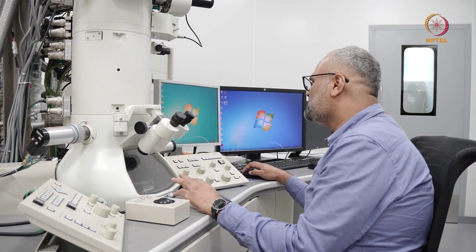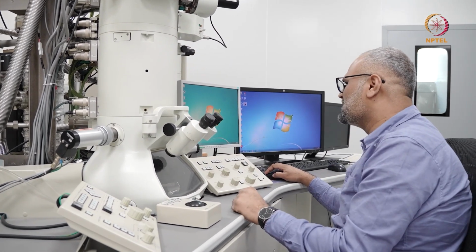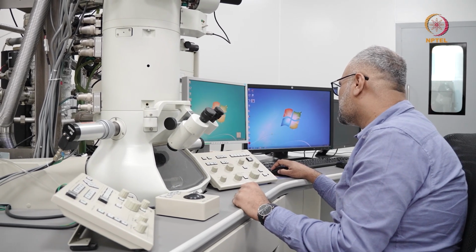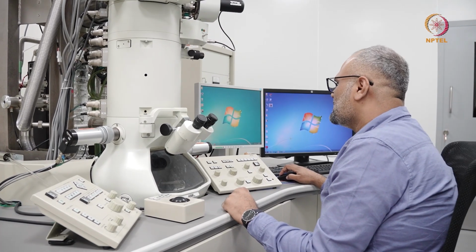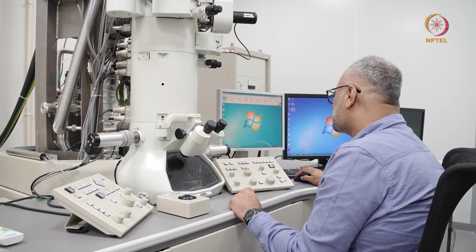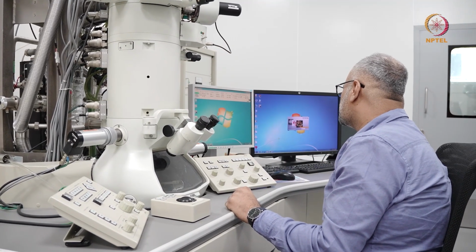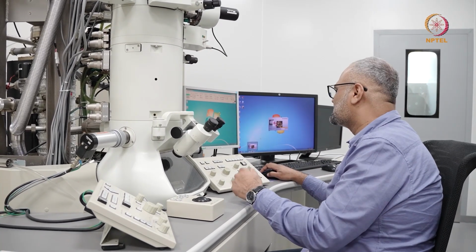When you come to the microscope, and if you notice that none of the software is on, for this particular JEOL instrument, you have to see that the TEM server is on. You get an indication here on the bottom right corner that the TEM server is on. And then you switch on the software here, TEMCon, which is the TEM control software, and you see multiple status windows here. And when you go to the other PC which has the control for the camera software, you switch on the camera software depending on whichever manufacturer camera you're using.